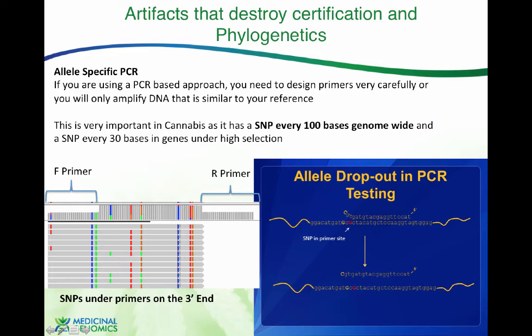Okay, so we are seeing some of that right here. This right on the 3' end of the primer, it's only amplifying this one allele, and we're ending up with marginalized data. The more primer space that you have, for instance, if they made this a single base in between, you would have a 50-to-1 ratio of primers to novel DNA that you're going to query, which means you're going to run into a lot of SNPs that throw off your assay. Now, in cannabis, this is a big no-no. In the human genome, there's a SNP every 1,000 bases. In cannabis, there's a SNP every 100 bases, which means the likelihood of there being a SNP under your primer is like 50% if you have 50 base pair primers like this.